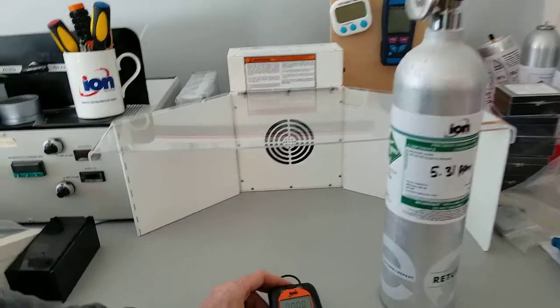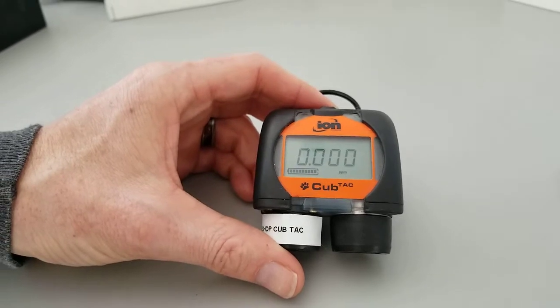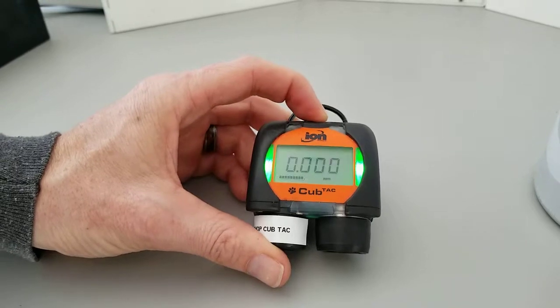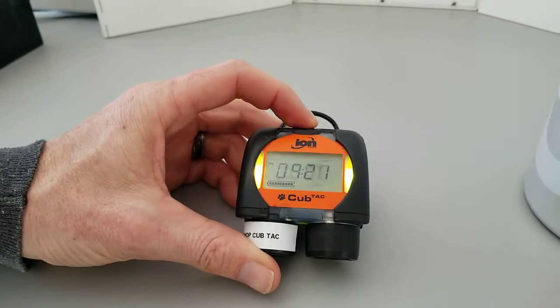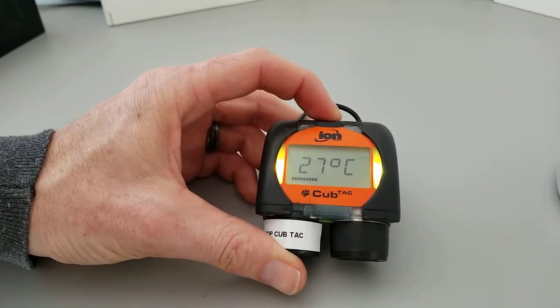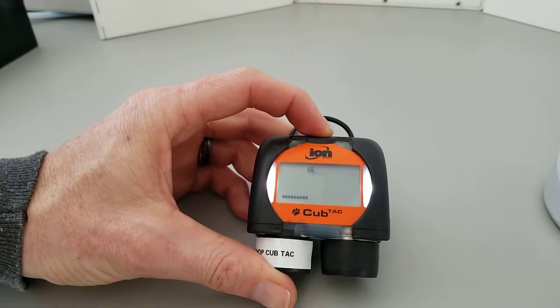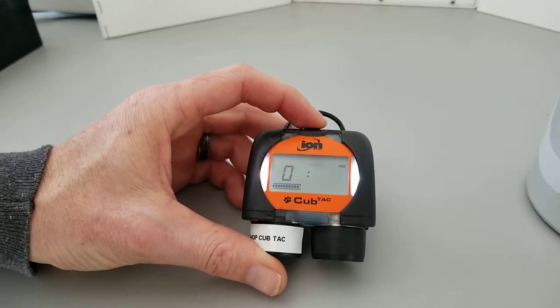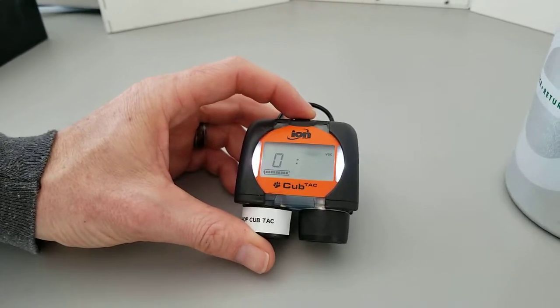To get started, we'll concentrate on the instrument. We start with the instrument running and press the button on the top several times. It rolls through the menu options. We stop when we see 'Cal' after the temperature reading. We then press and hold for one second until it beeps and let go.